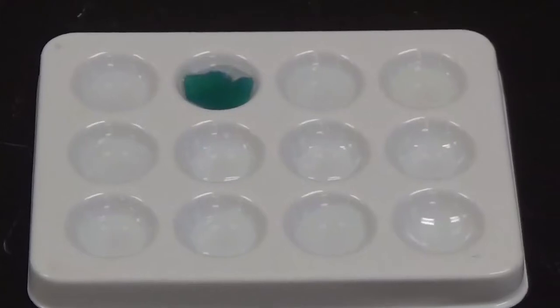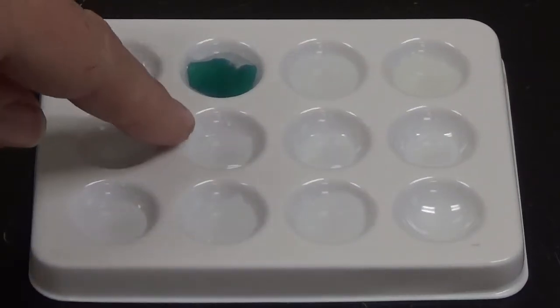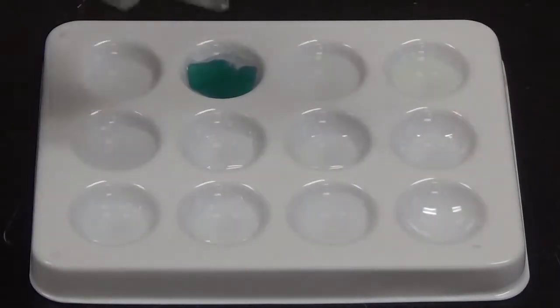There was a white solid that formed. So a chemical reaction happened there. Sorry, I know it's hard to see those white solids that form when you're not here in person. Okay, so next up I'm going to add silver nitrate. So silver nitrate goes into this well.